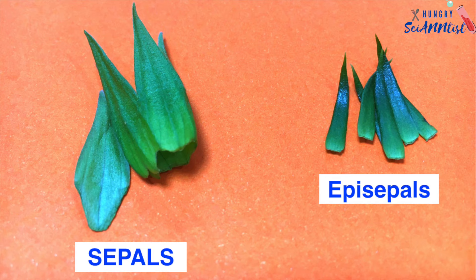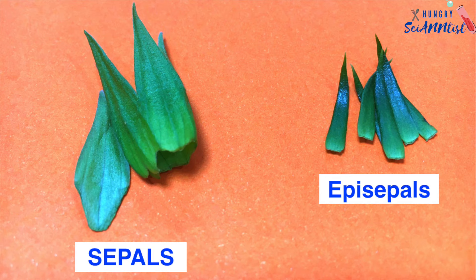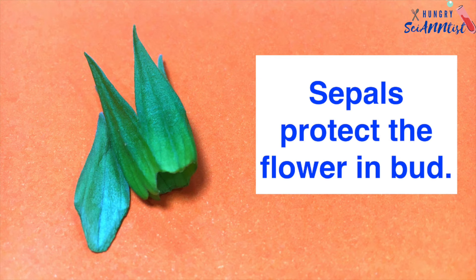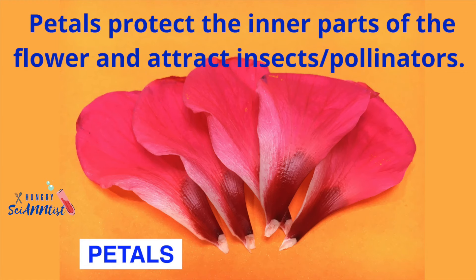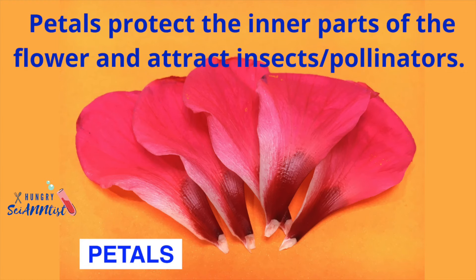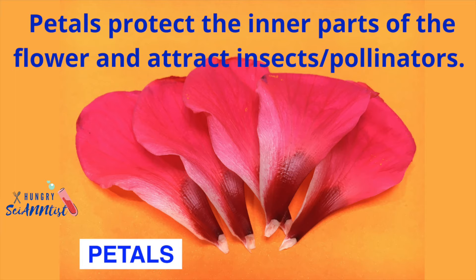Sepals and episepals. Sepals protect the flower in bud. Petals protect the inner parts of the flower and attract insects and pollinators.